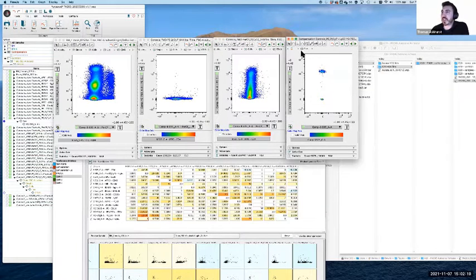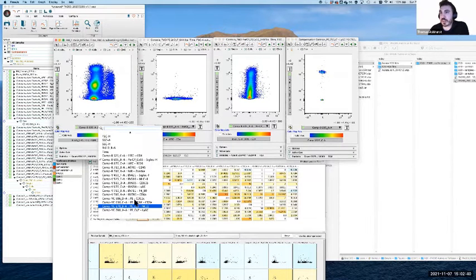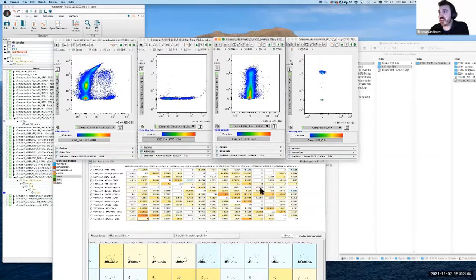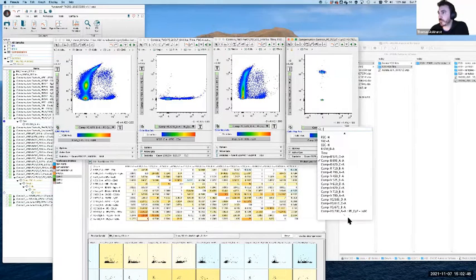But there does come a point where things do happen in the data, and you wonder: do I just throw this whole experiment out because something has gone wrong, or can I apply a methodical way that allows me to make corrections, knowing that it's not going to alter the data? Now, this example seemed pretty straightforward, but there's a different example where it becomes much more complicated. So PE-Cy7 versus PE-Cy5 is the other one here, which we'll come across.